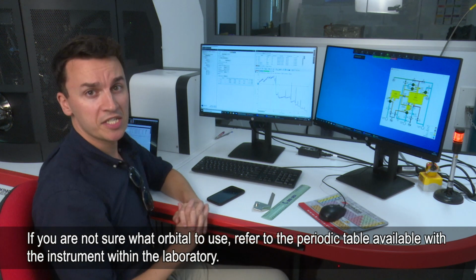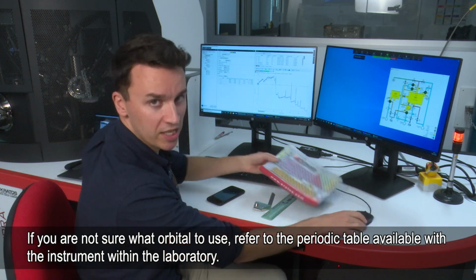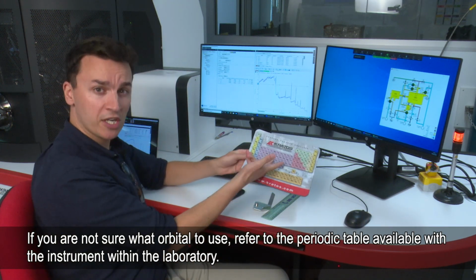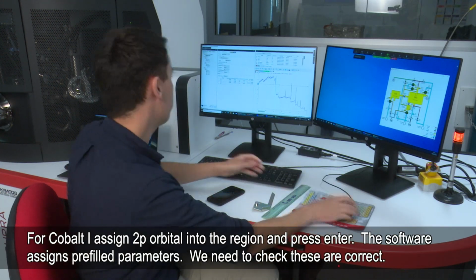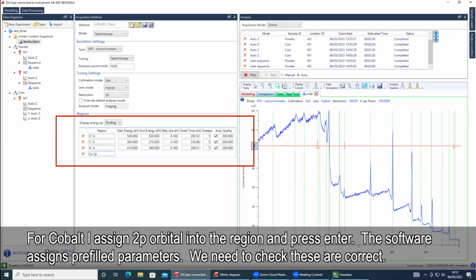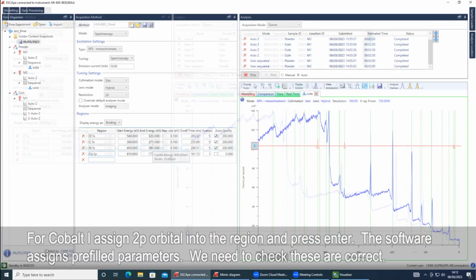And if you're not sure which cobalt peak to use, we've got a trusty periodic table just here. So we just have to go to this and it will tell us what we need. So for cobalt, I know that it should be a 2p. Press enter and it gives me some parameters already filled in. So then what I have to do, I just have to check that this is correct.